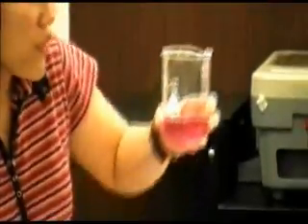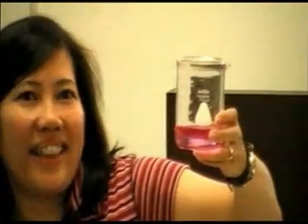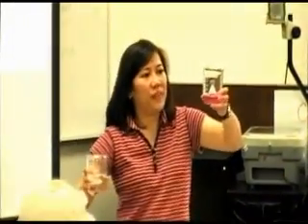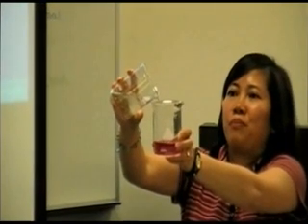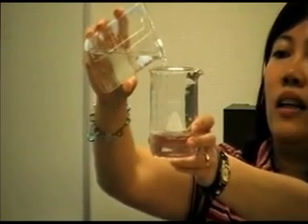Okay, yes, it is. Now, I think I don't like pink. Alright, let me change it back to the clear color of the solution. Let me give that a try and see how it works. Okay, now do you see pink? No. Now you don't.